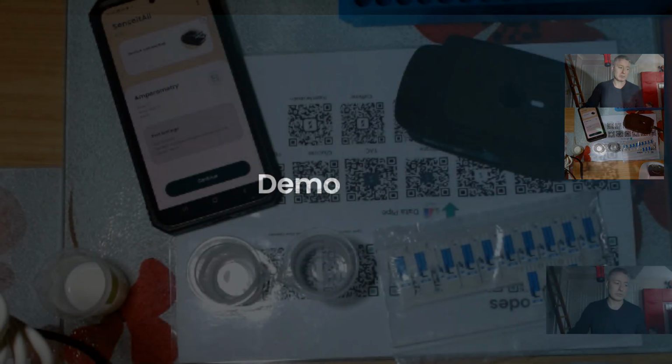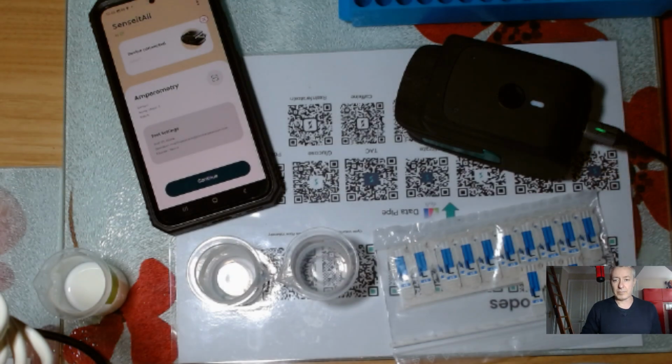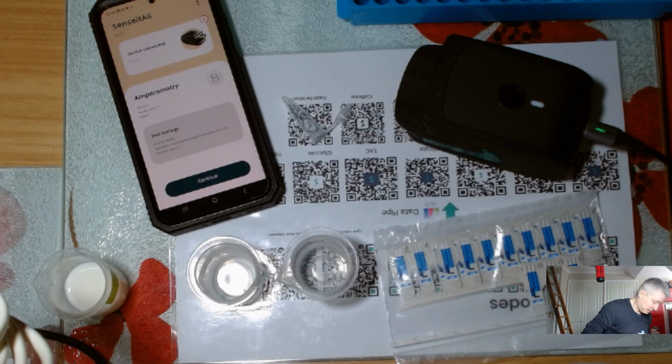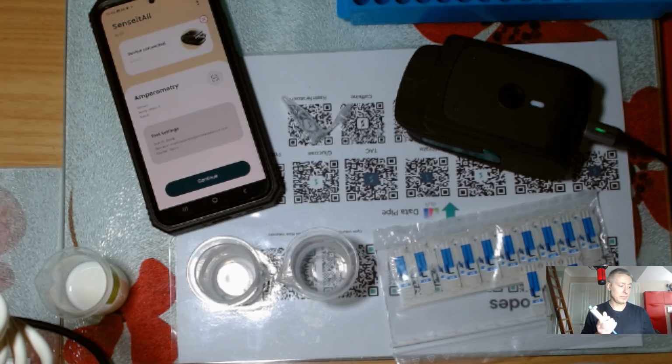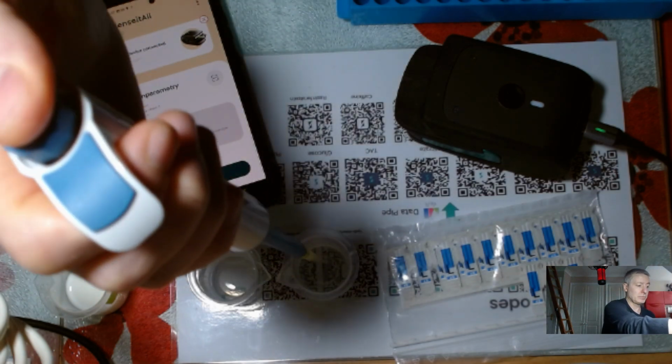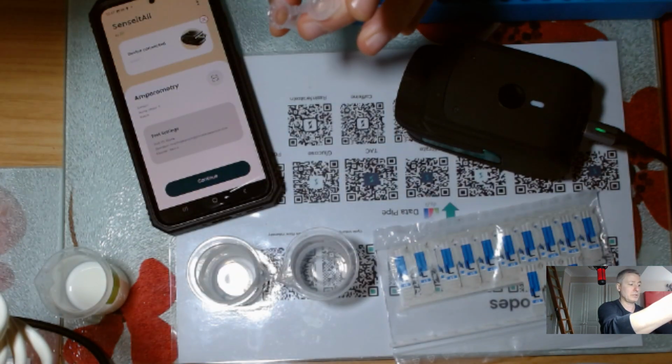So I've got the word demo. This is just to remind me to go ahead. I'm going to prepare things first of all. I'm just going to grab a quick tube and a pipette. If you see me reaching behind me, it's just to get pipette tips. So I've got a pipette tip here, and I will be taking 100 microliters of the hydrogen peroxide, which I will do. I'll put it in the tube.